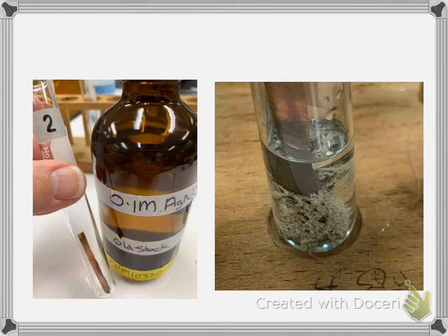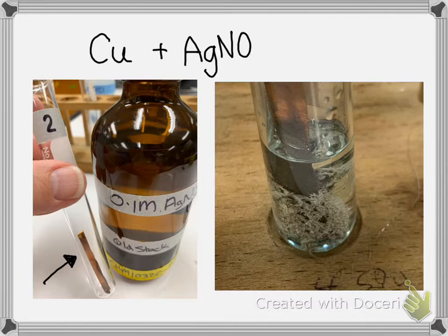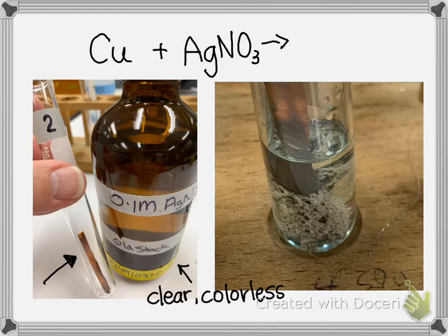The second one is one of my favorites. I have copper metal, and you can see it in the test tube, similar to what we used for the combination reaction. And I added it with silver nitrate, and silver nitrate is a clear and colorless solution. I'm just going to write here, this guy is clear, which means it doesn't have any particles, but it's also colorless. And in this reaction, the copper is kicking out the silver.